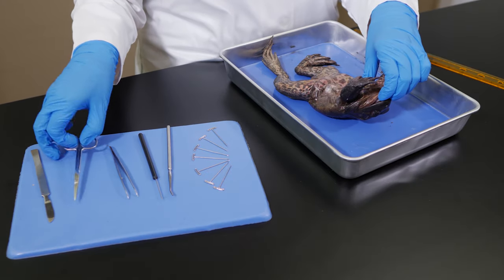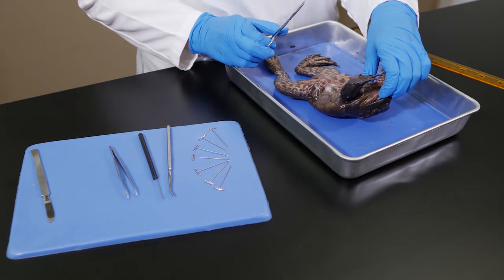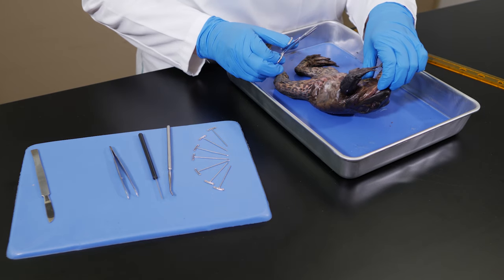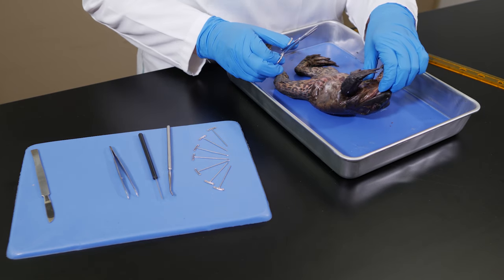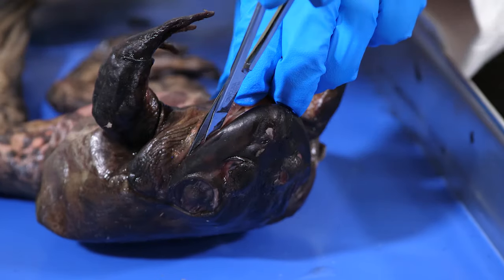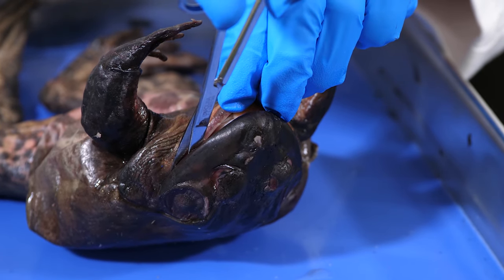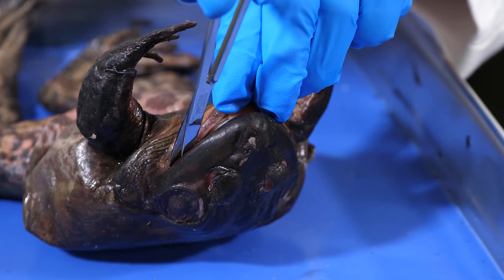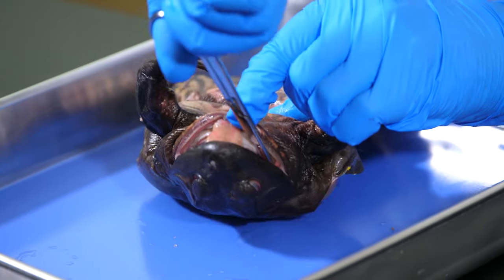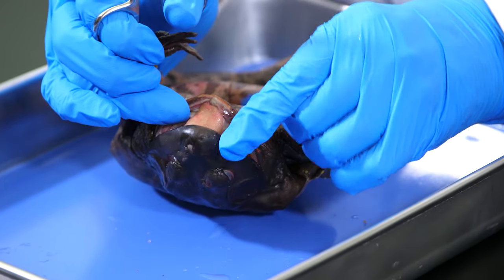Next, we will use a pair of scissors to cut the muscles at the corners of the mouth in order to release the jaws. As we pull up on the jaw, we should feel it let loose. We can then pull up on the lower jaw to open the mouth.